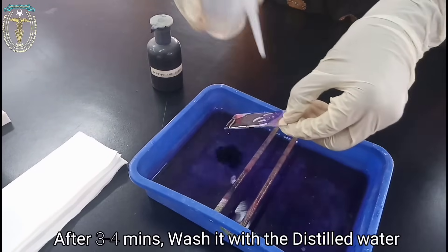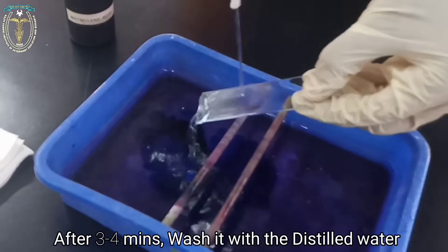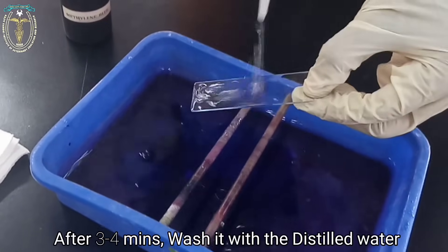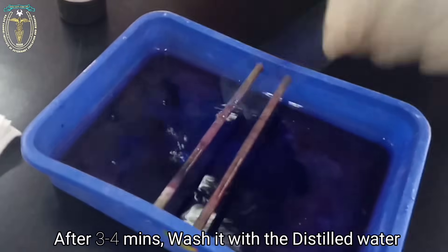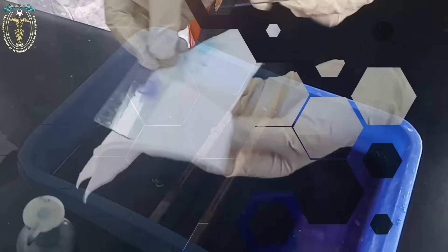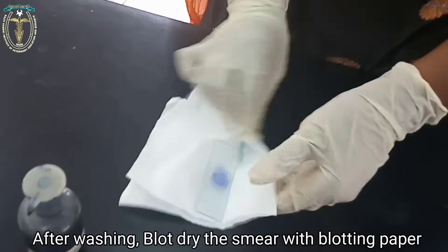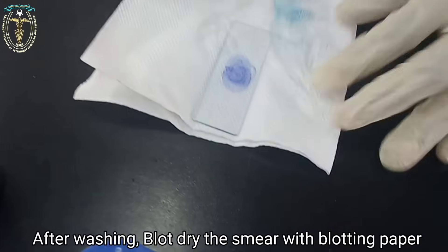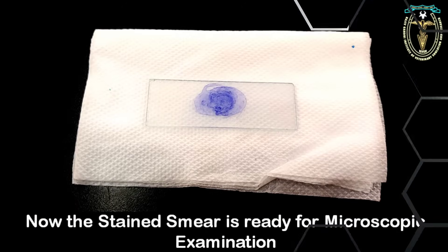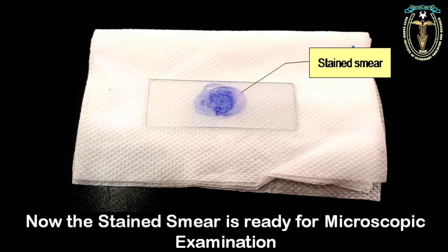After three to four minutes, wash it with distilled water. After washing, blot dry the smear with blotting paper. Now the stained smear is ready for microscopic examination.